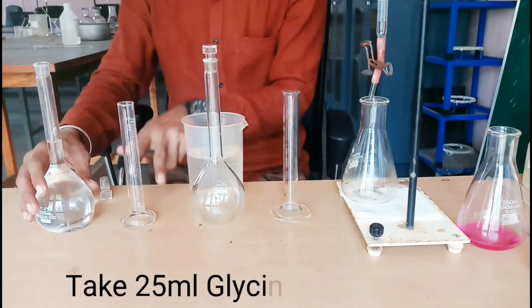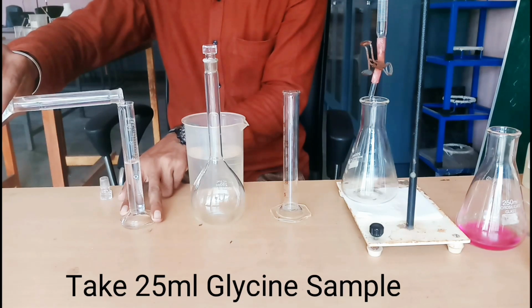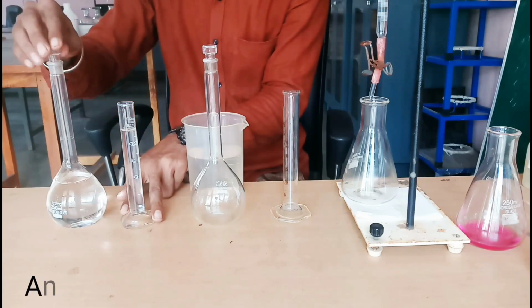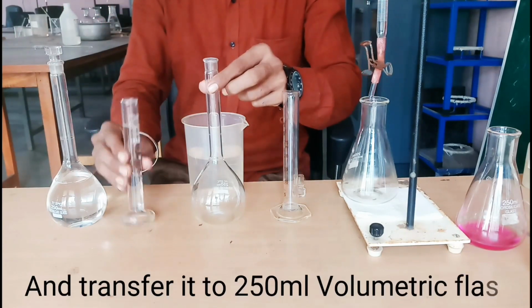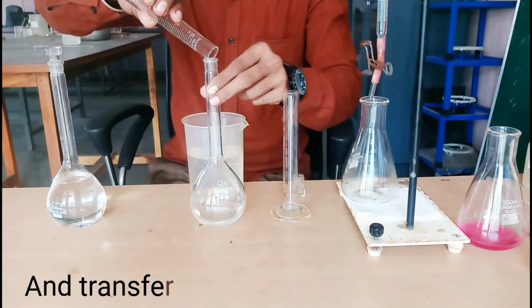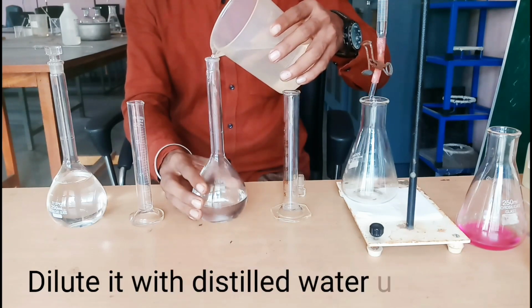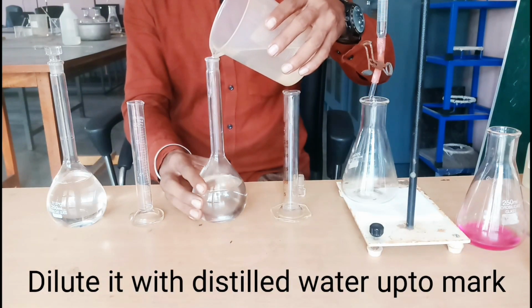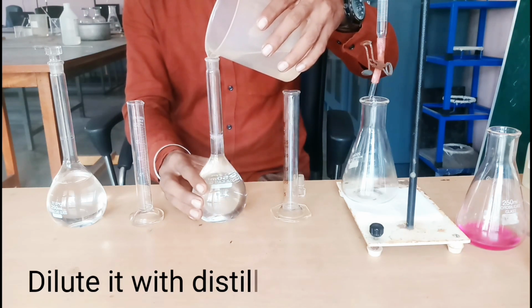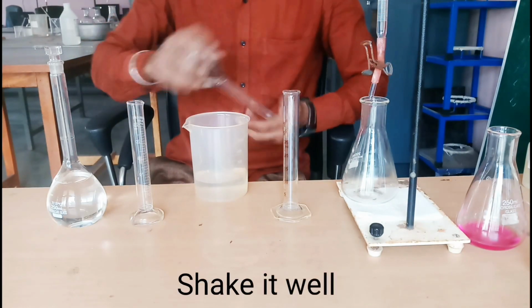Now take 25 ml glycine sample. And transfer it to 250 ml volumetric flask. Dilute it with distilled water up to mark. Shake it well.